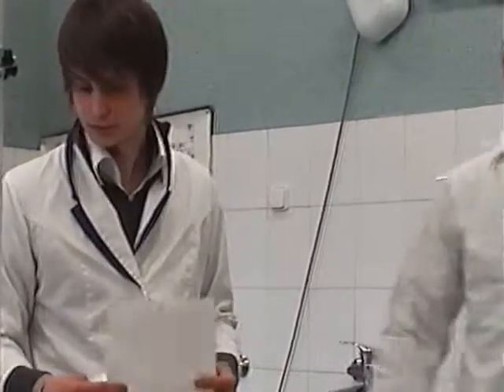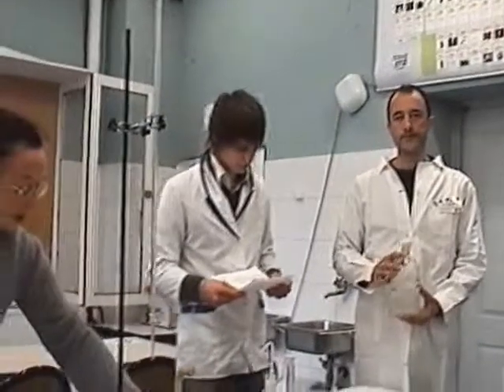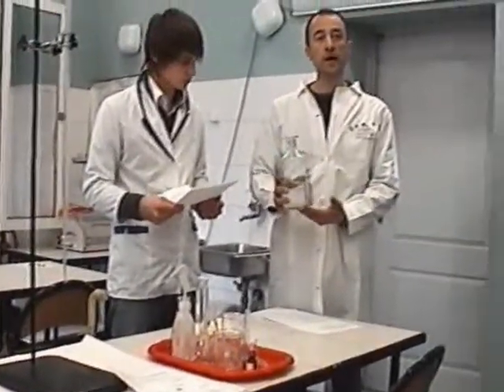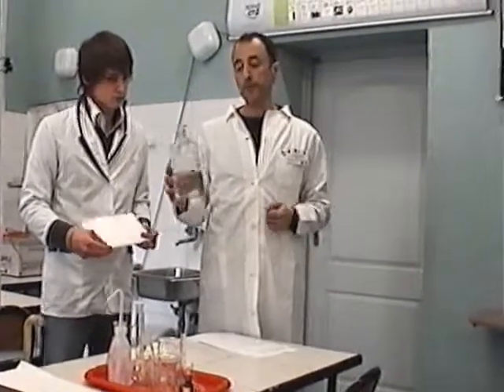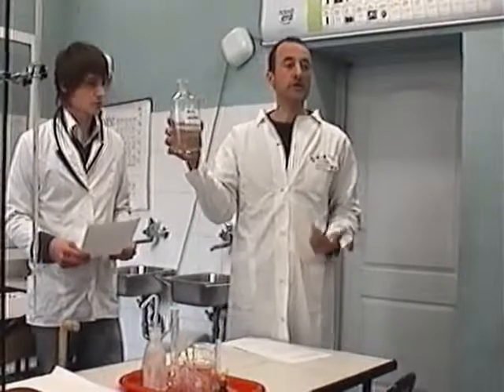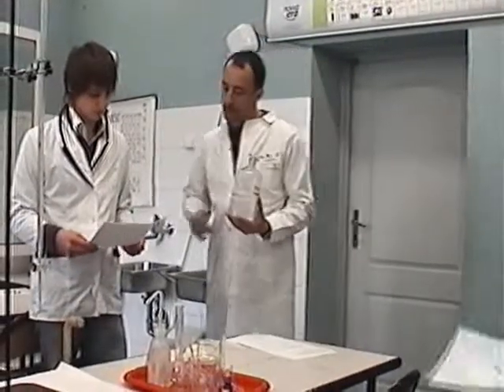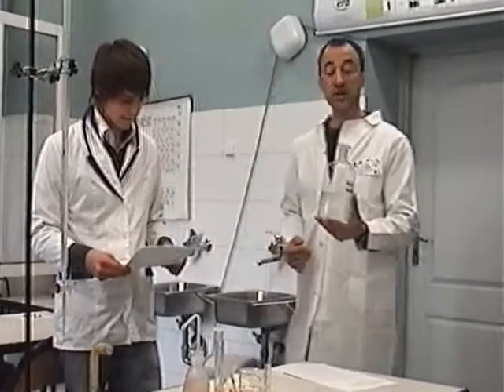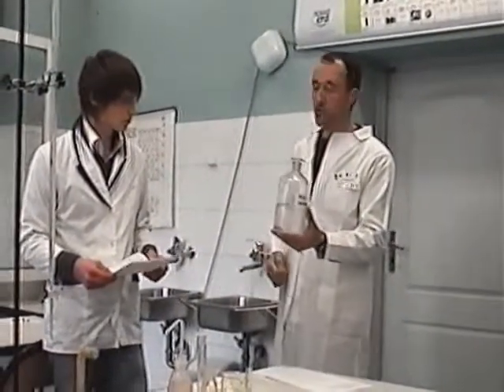I think we have got the working sheet. The problem is how to make drinkable water with sea water — water with salt in it. The first explanation is purification by distillation. We will show you how to do that.